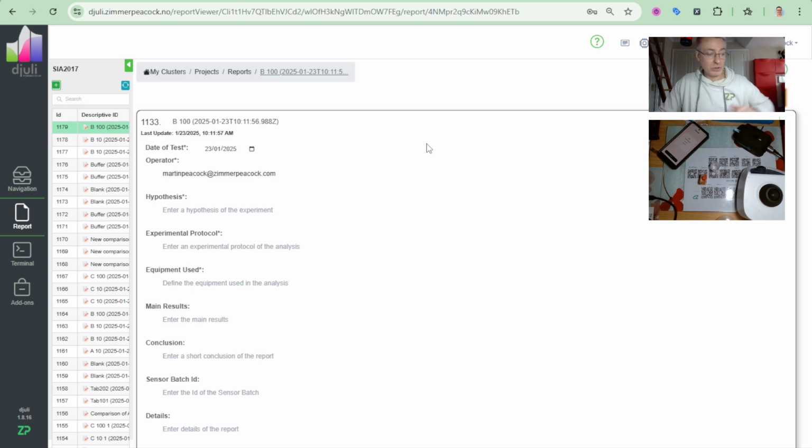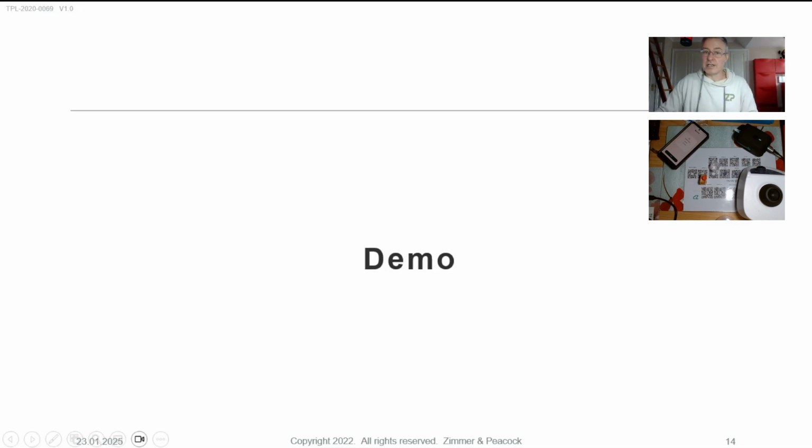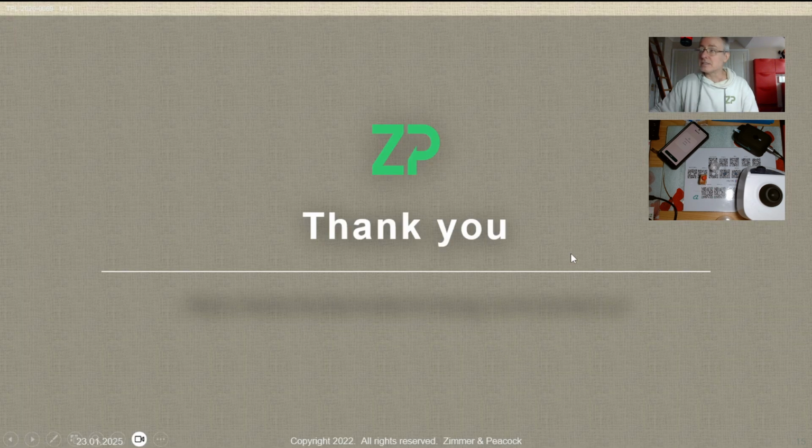And when I tested it at 1 in 10, it was a little bit high. I followed the instructions on the device, but I checked the data. I checked the signal before, and then I did a 1 in 100. You saw how I did it, and then I got a reasonable signal. So hopefully that will help in real time. I think it's important to, you can use the app, but you also have the whole power of actually looking at things in the cloud and saying, is this making sense to me?